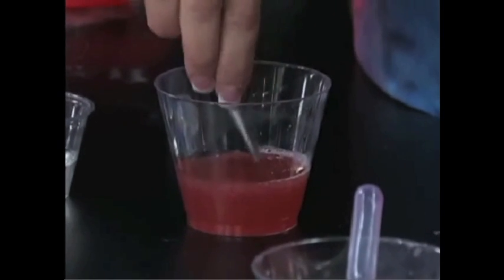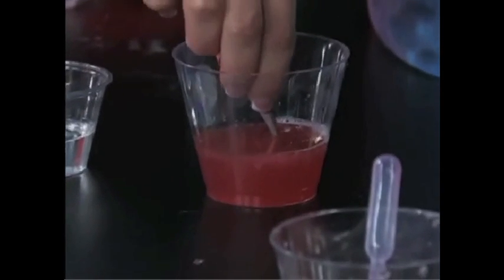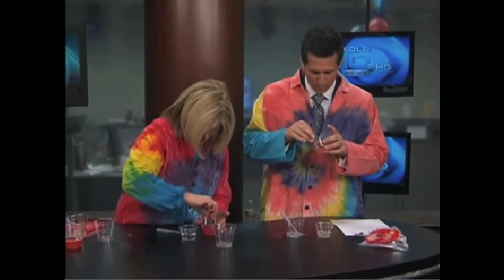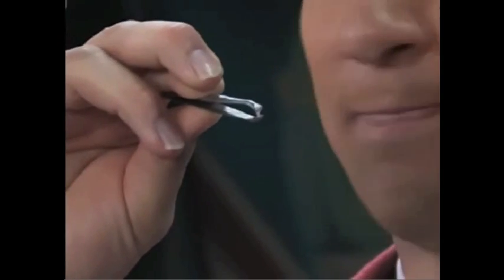That's what makes a strawberry a strawberry. Can you look at it under a microscope? Yeah, lay it on a slide and pull it out — you can see it right there. You can extract it all. For more information on the strawberry DNA — Quircles.com and OzarkFirst.com.